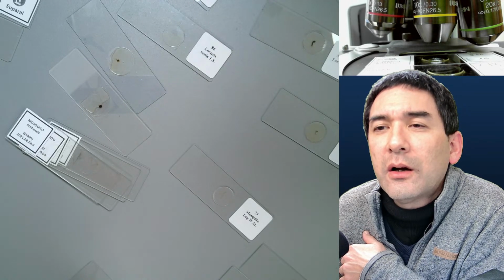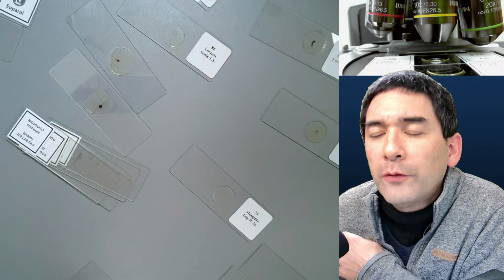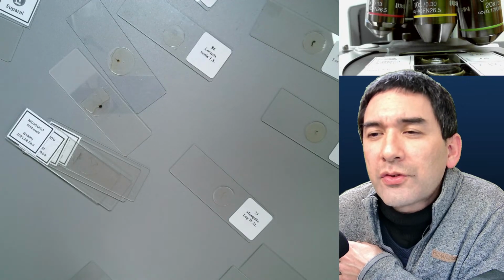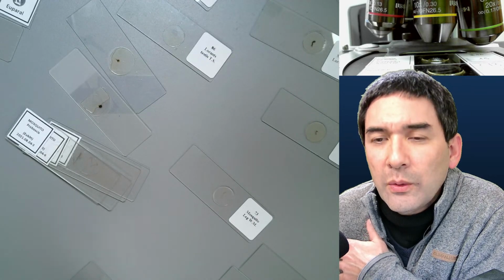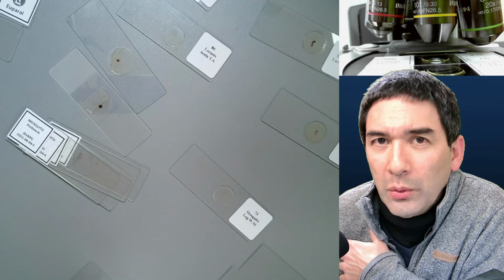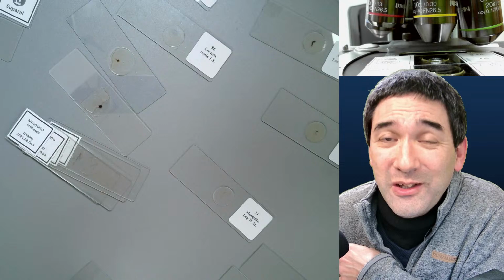Okay, I see that there are a couple of questions here that I did not respond to yet. I often look at dead insects I find around the house. On my compound microscope, I have difficulty with lighting. Could you suggest any lights? Well, generally, if you put the whole insect directly on a microscope slide, then it's too thick.